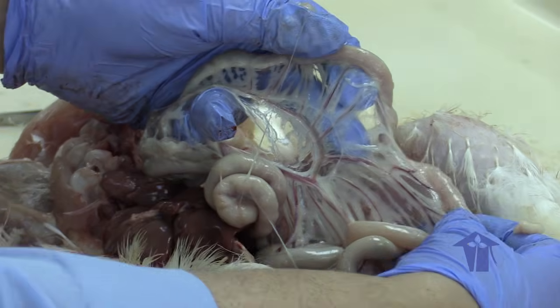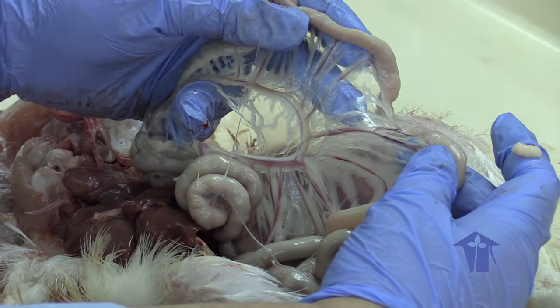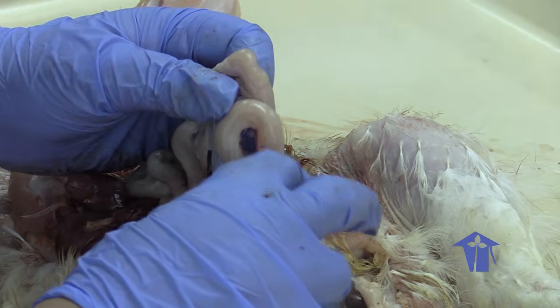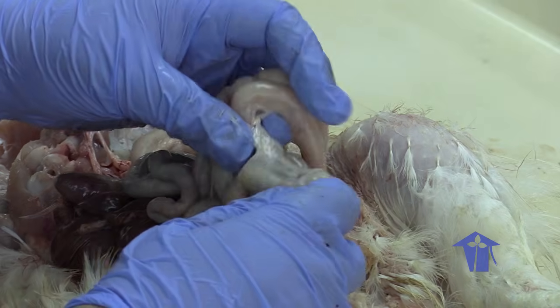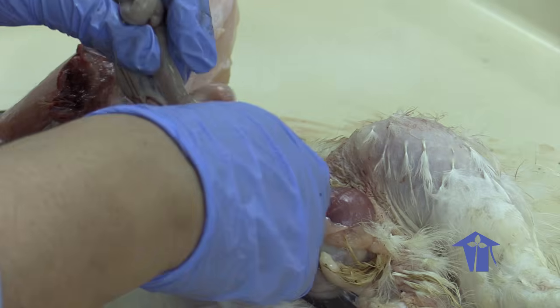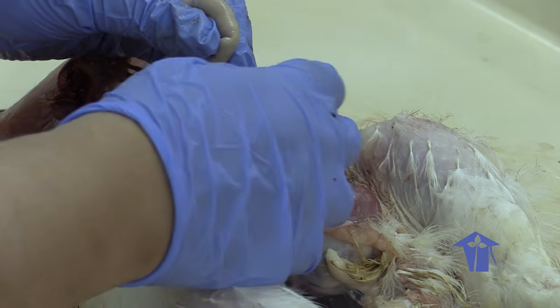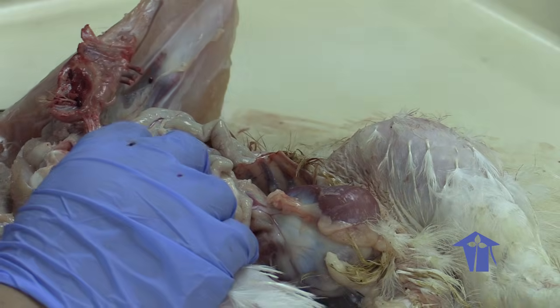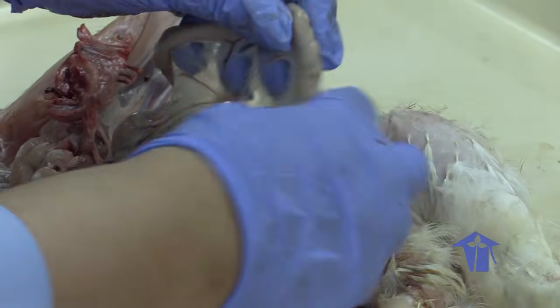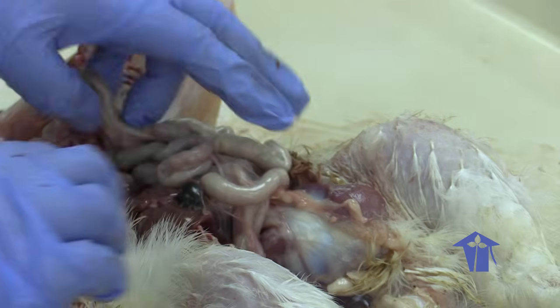So you have a lot of blood vessels that are going to be carrying digested food in the blood vessels back to mainly the liver, from whence it will go to storage and to the heart for distribution to the rest of the organism, right? So we could cut out all of these mesenteries and spread the intestines out, so you will see how long they are, but I want us to appreciate how vascularized and how organized these mesenteries are.